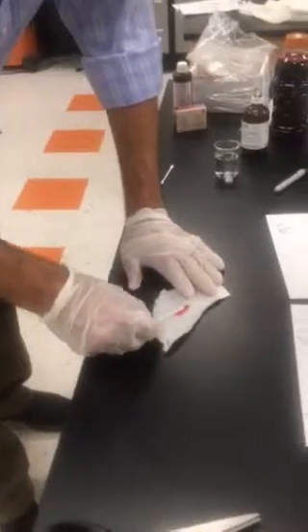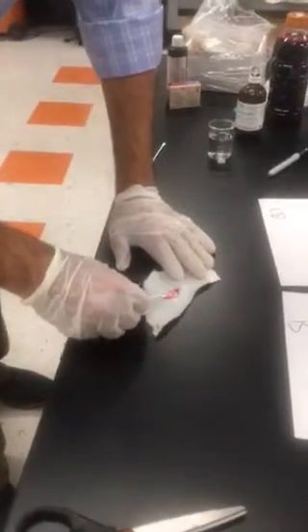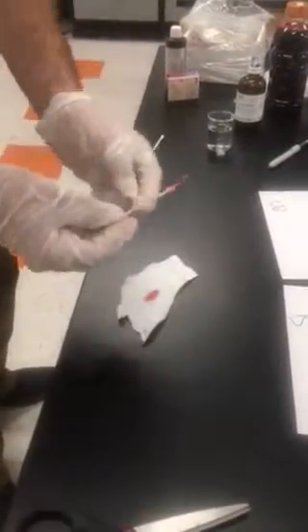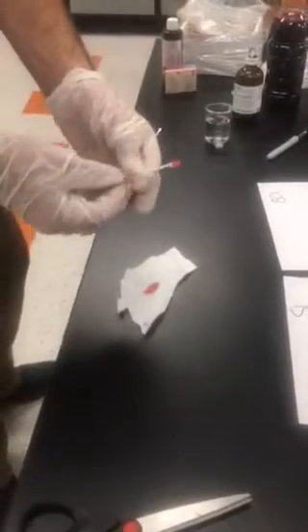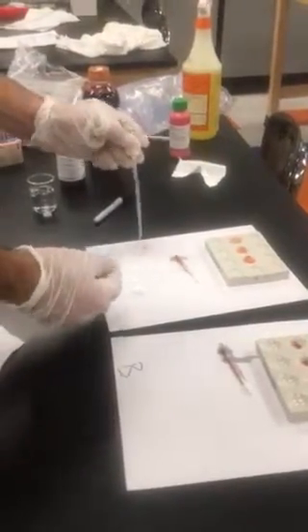And we're going to go to the stain, and we're just going to rub the swab on the stain. And this is not destroying the stain, which is important. If further forensics analysis needs to be done, we can now send this to the lab. If we put the Kastle-Meyer reagent directly on this stain, it would destroy the stain and it would no longer be useful. So we want to make sure we have enough sample left for other analysis. Once we've got some of our sample here, we can now apply our presumptive test, a few drops of Kastle-Meyer.